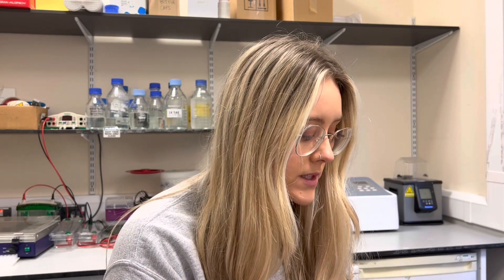Hello, good morning and happy Monday! It's eight o'clock and I've arrived into the lab. I'm not speaking in the office because Axel is in there and I get a bit shy, so I've taken up refuge in my little lab here that no one is currently using, so I can have a little chat this morning. I'm going to have a look at my planner to see what the plan for the day is and then time block everything out.